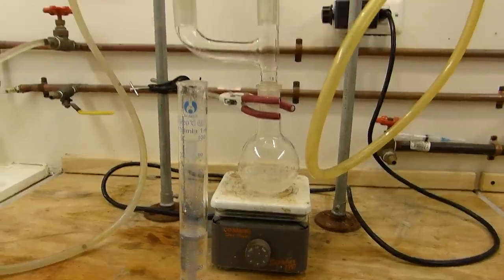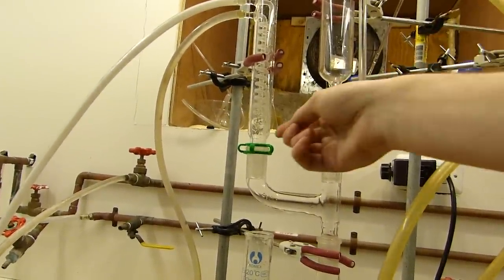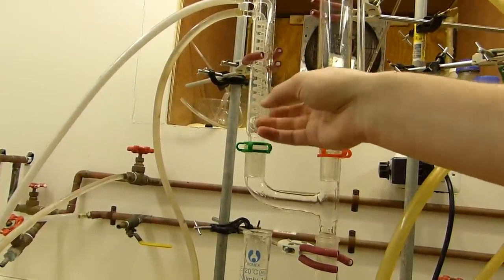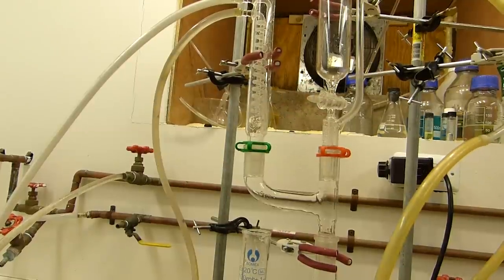Also indicating that the reaction is over is the appearance of vapor here in the coil condenser, and we're slowly getting drips of water out of there now, so I know that we're starting to reflux.